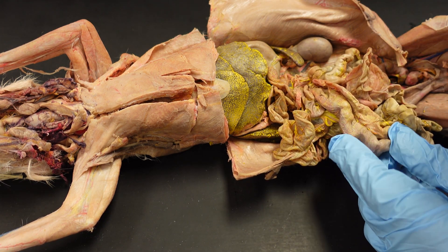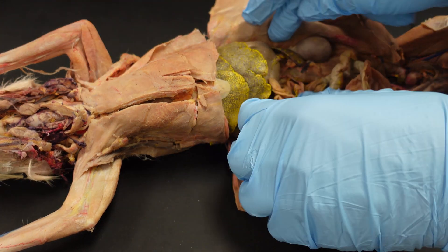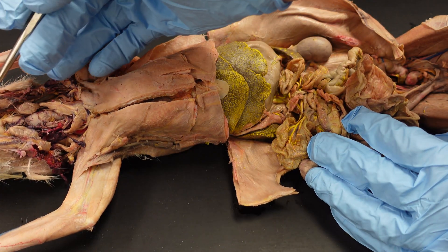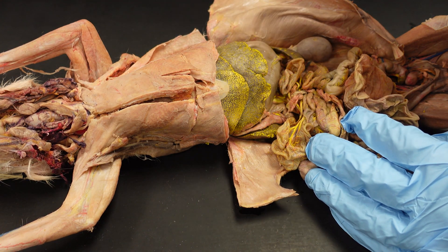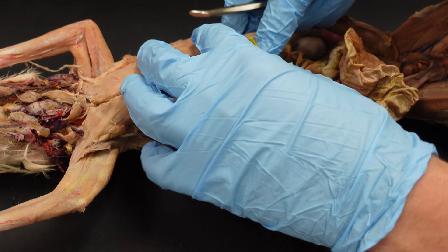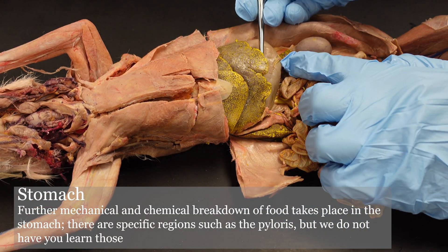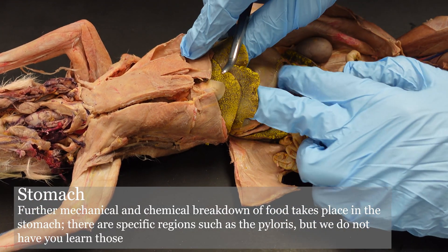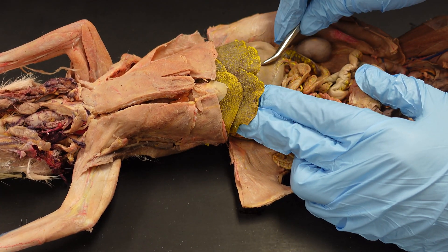This will be kind of like what your rabbit looks like when you open it up. Starting out, we have an esophagus that goes back that way. That is actually not one of the terms on your terms list, but it empties out into the stomach. So here's our stomach, which is beneath the liver — you'll see the liver in a separate video.